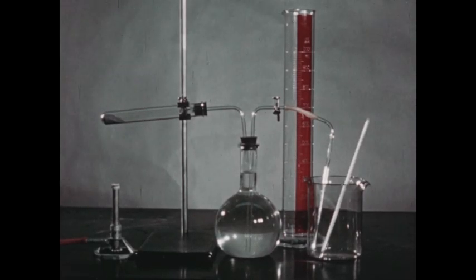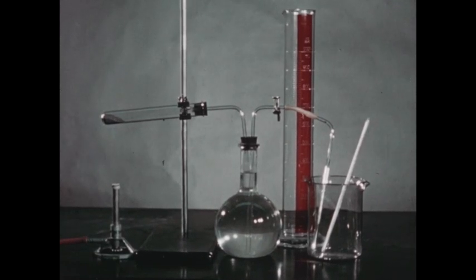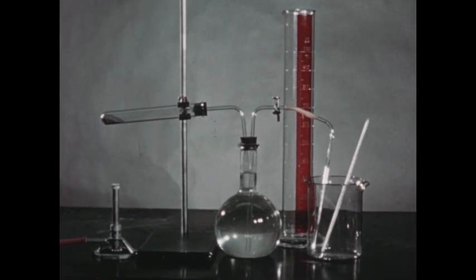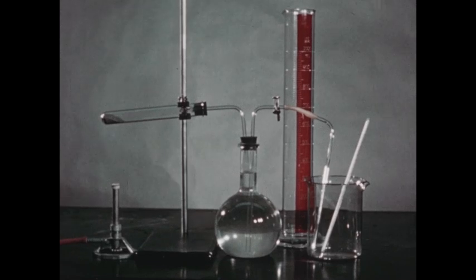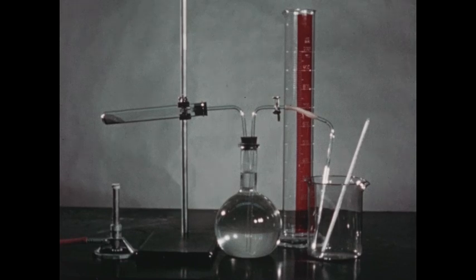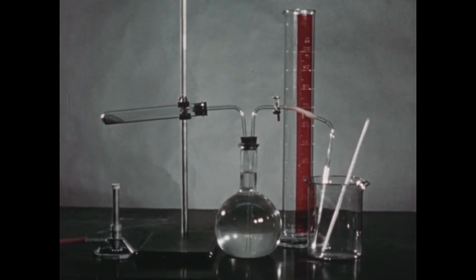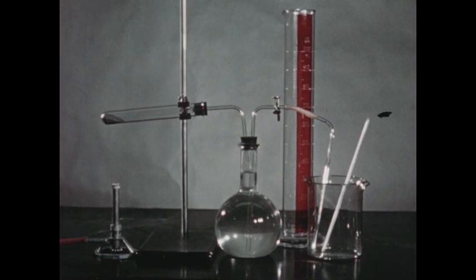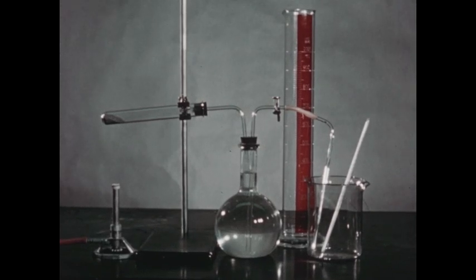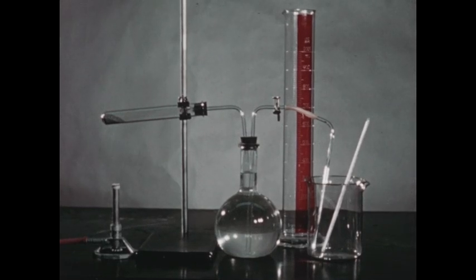You have previously learned that the atomic weight of oxygen is 16 and that the molecule of oxygen gas is diatomic and therefore has a weight of 32. You've also learned that 32 grams of oxygen, the gram molecular weight, or one mole, occupies a volume of 22.4 liters at standard conditions. The purpose of the experiment today is to verify this statement that one mole of oxygen gas at standard conditions occupies a volume of 22.4 liters.